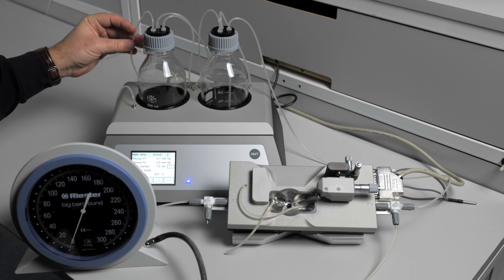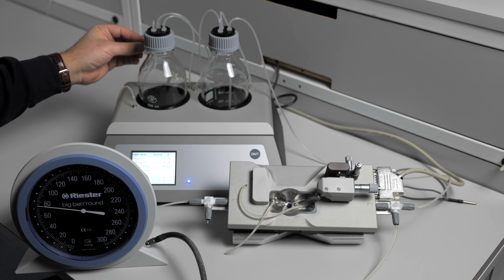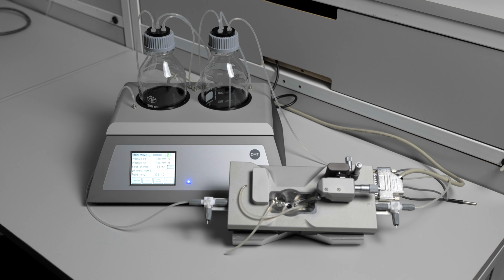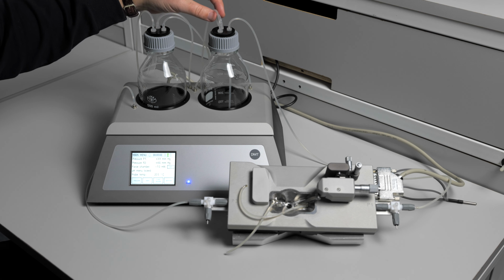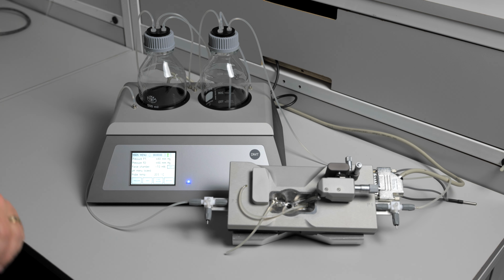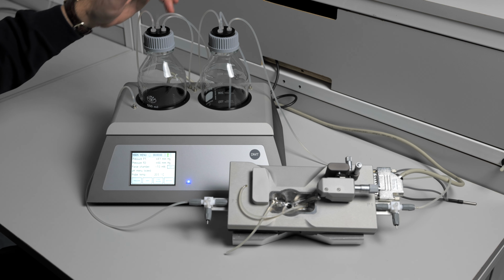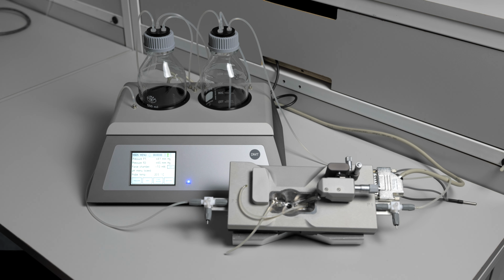In order to test the new tubing, you still need to pinch the tubing going to the P2 bottle. Add pressure, and you see that after replacing the tubing, pressure is now holding very well. It is very unlikely because this tubing is very rarely handled, but it is possible to have a pressure leak in this tubing on your interface. As a last resort, you should try to replace the tubing going from ports 2, 3, 4, and 5 to the interface top. If you are still experiencing trouble with the pressure leak, please contact your DMT representative for support.